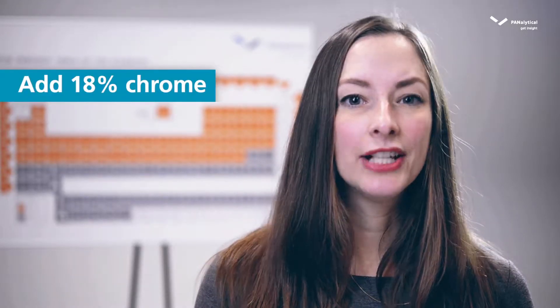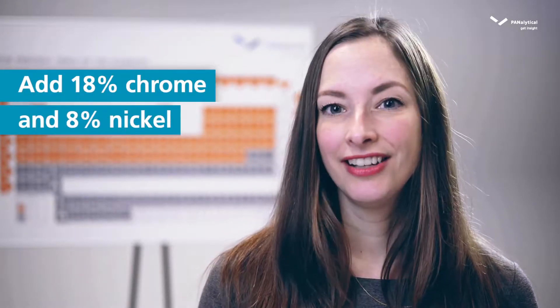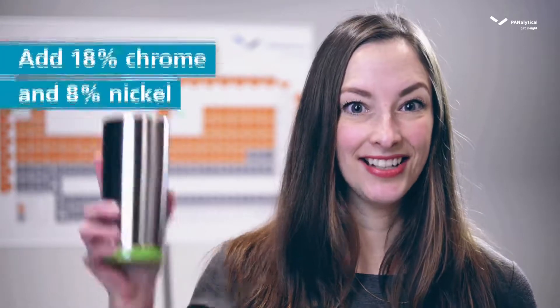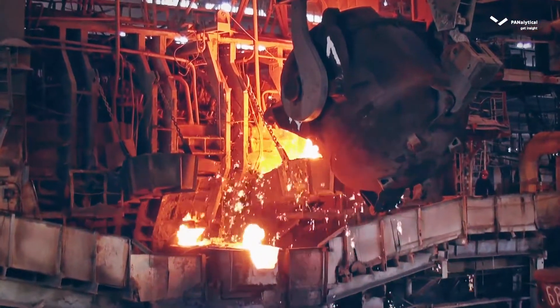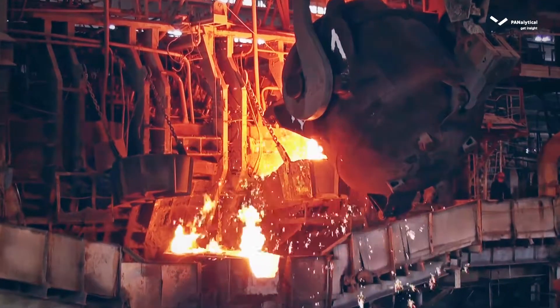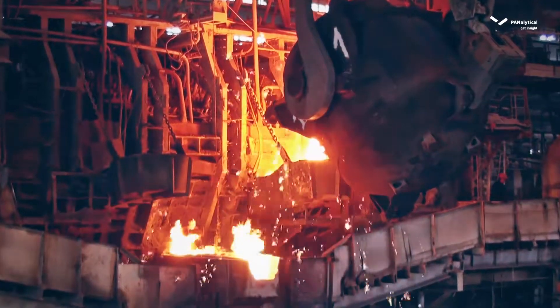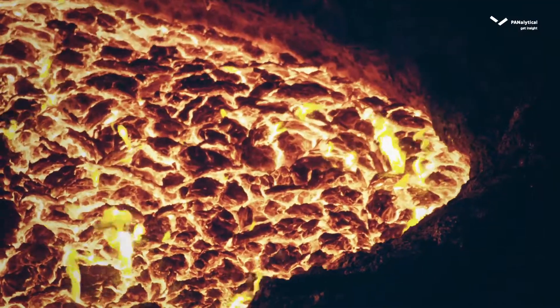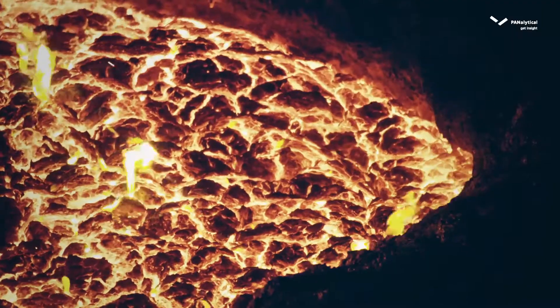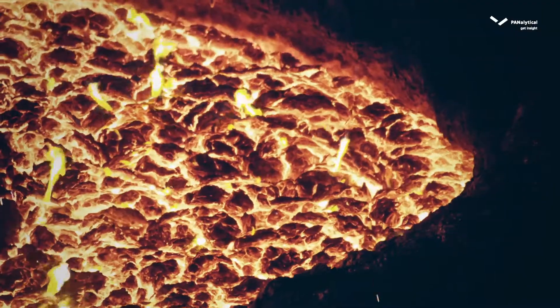Normal iron will get rusty in time, but when you add 18% chrome and 8% nickel, you will get stainless steel. But how can you determine the right composition of steel — 18% chrome, 8% nickel — and ensure consistency when it is liquid hot steel in a steelworks?